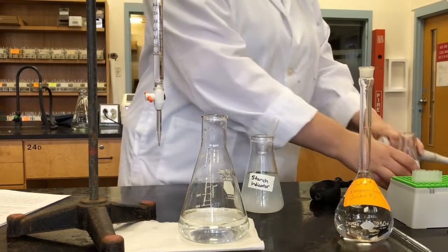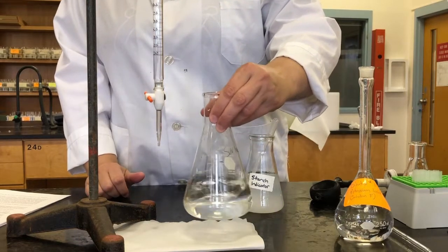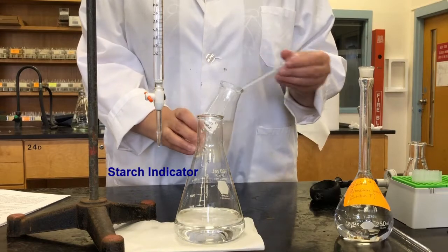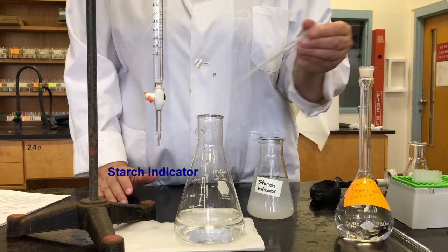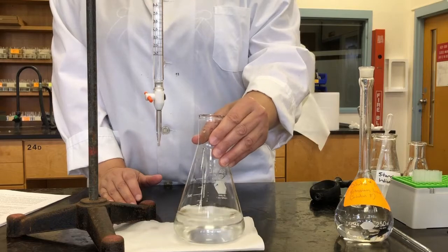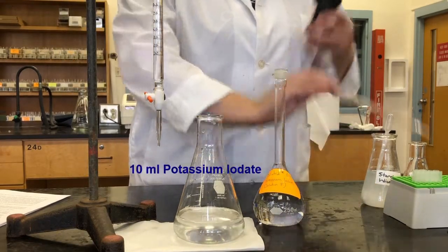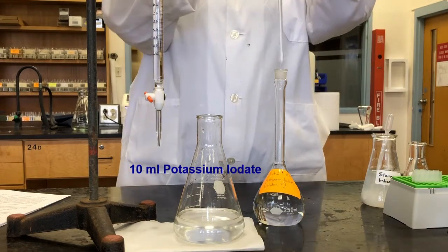There we go. And a few drops of our starch indicator. That should be enough. And then we add our potassium iodate solution. Remember, this is the one we diluted last week.